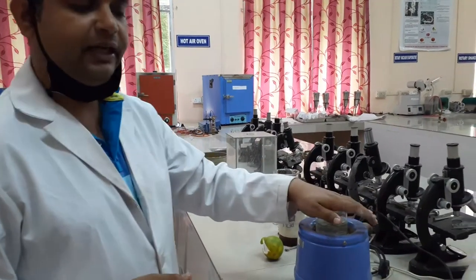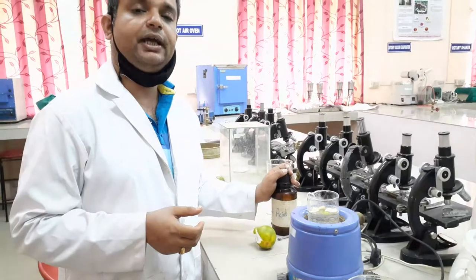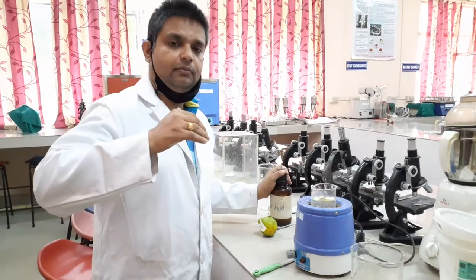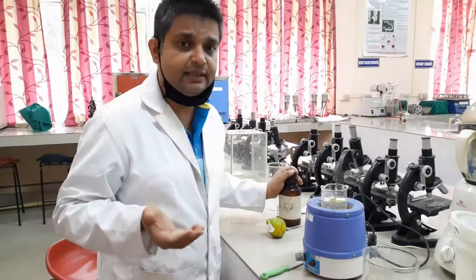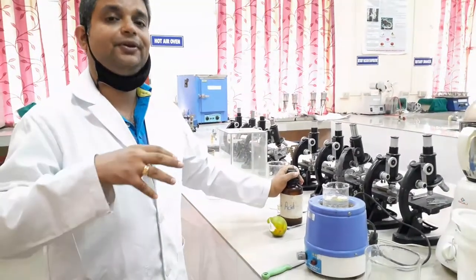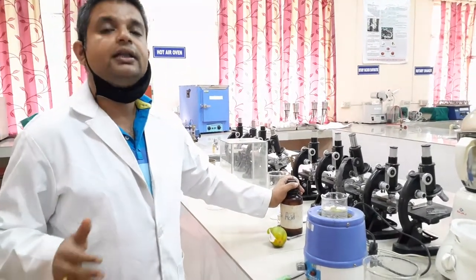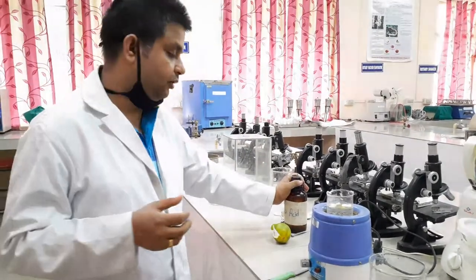The pH maintenance is very important here. The pH should be maintained around 2.8. It should be acidic in nature. If we add more amount of acid — if the solution is more acidic — then whatever pectin is separated will get dissolved. And if it is less acidic, meaning more than 2.8, then obviously the pectin precipitate will not form.